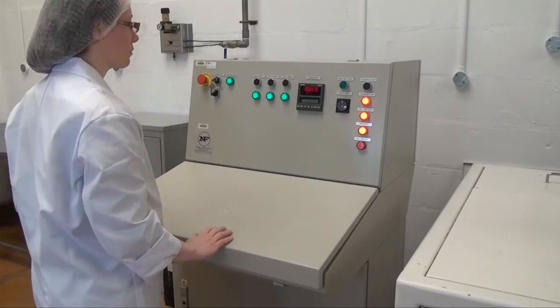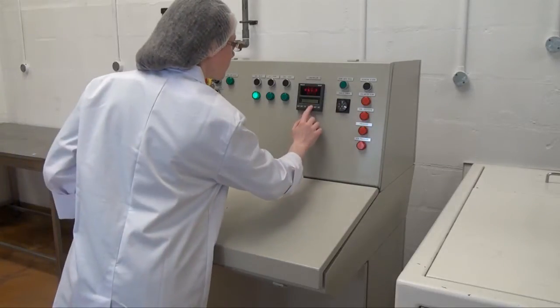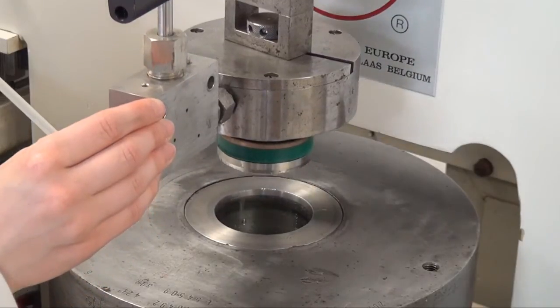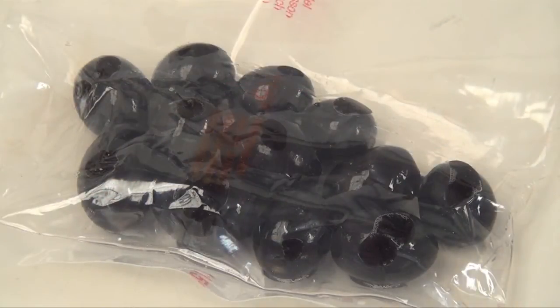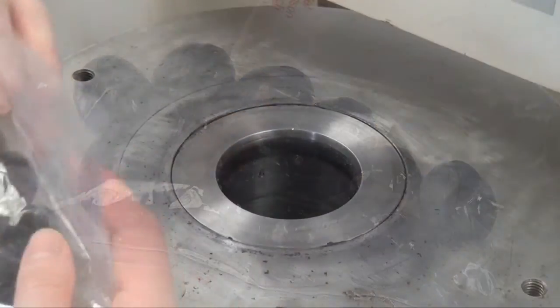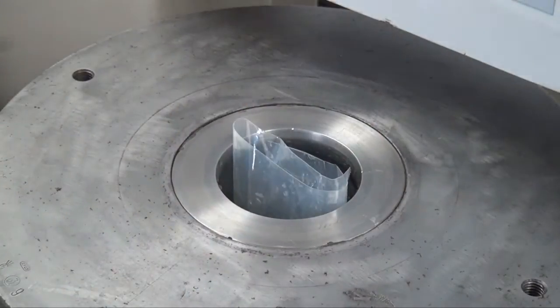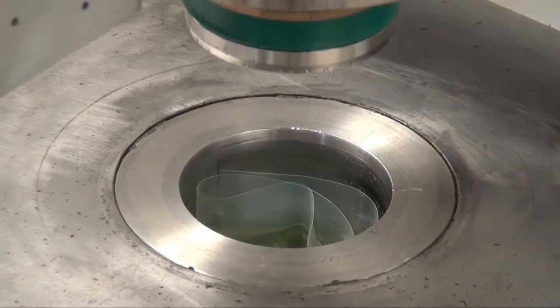High pressure processing uses pressures of 100 to 600 megapascals for up to five minutes to decontaminate foods or change their functional properties. This pilot scale system has a volume of about 800 millilitres. Industrial equipment can process over 500 litres at a time.